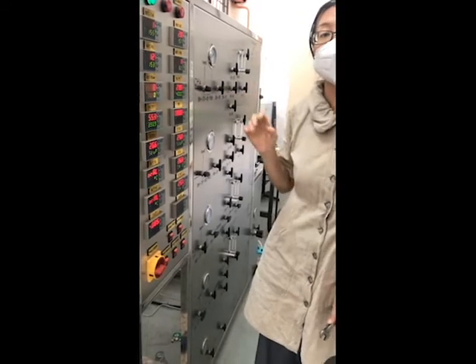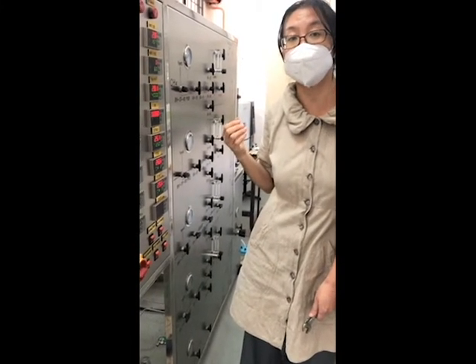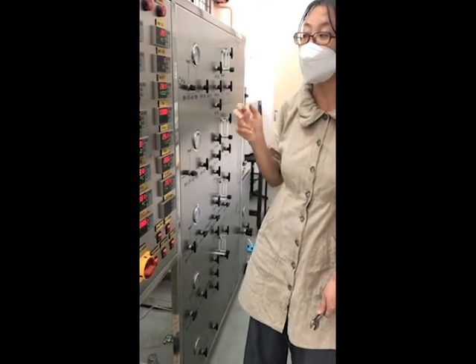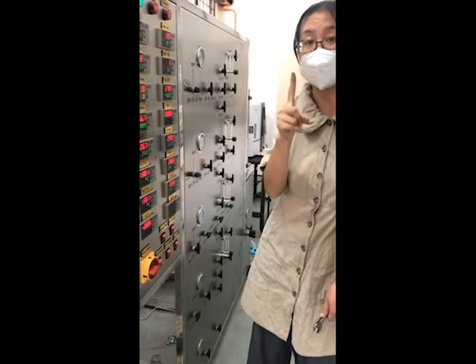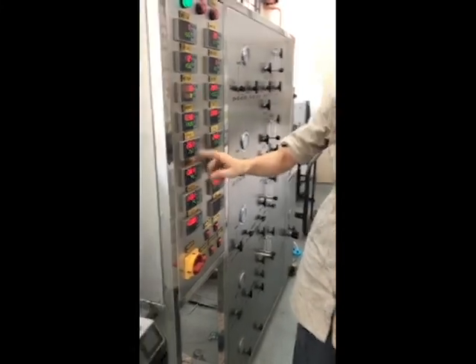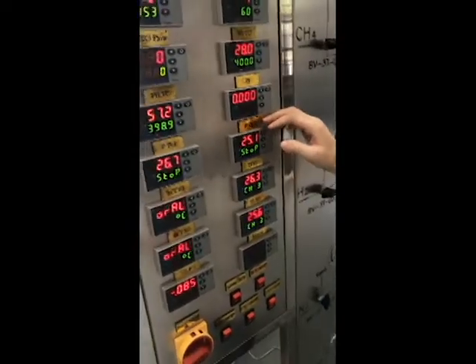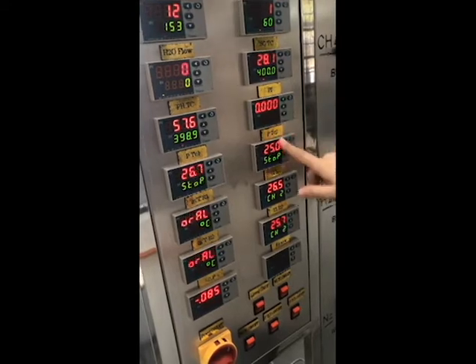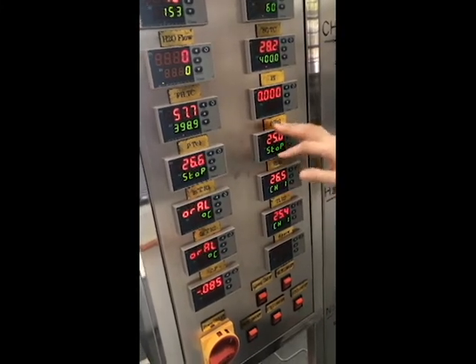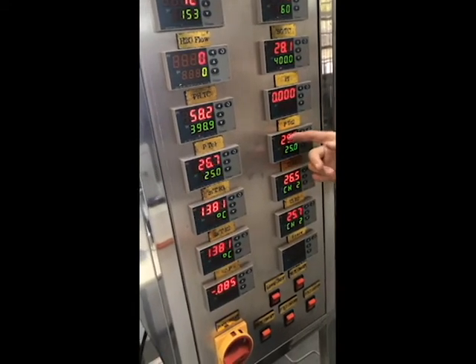They are conducted under different temperatures and with different catalysts. There are two reactors installed. But in your case, because you are doing only one reaction, you are now using temperature 1. If you install your catalyst in furnace 2, then send furnace 2, but I will only focus on this one. If you didn't use furnace 2, you can ignore it.